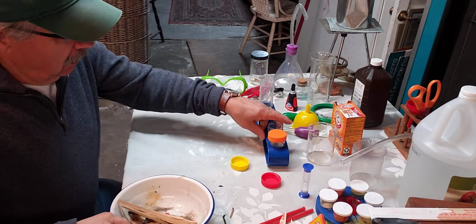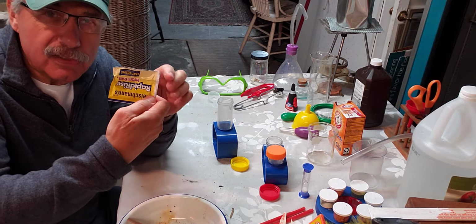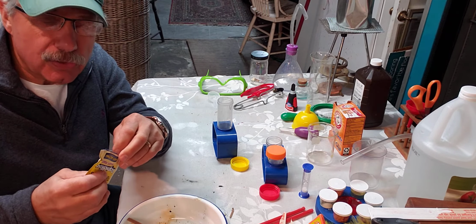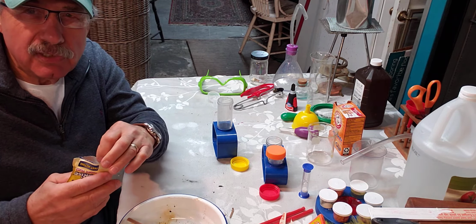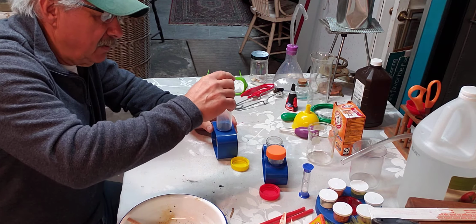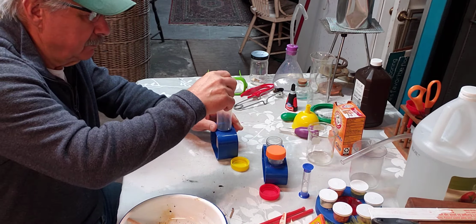Okay, so let's take this test tube and let's add yeast. We're going to make the oxygen first. And I got a little package of yeast, and your mother uses this in baking bread. And you have to get yeast that's fresh. When I was a classroom teacher, I tried using yeast a few times, and it didn't make oxygen. It didn't work very well. And I found out later it was old yeast, and it wasn't very active. So we're going to add a little yeast to this. As you can see, I've got yeast in there. Maybe I need just a little more.